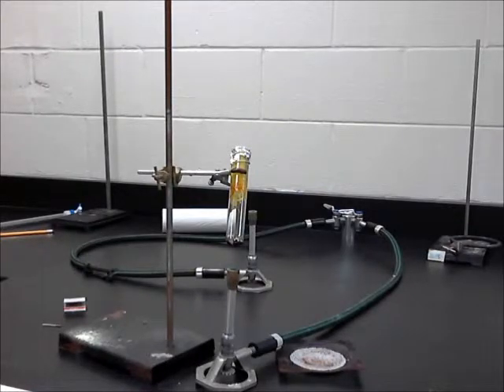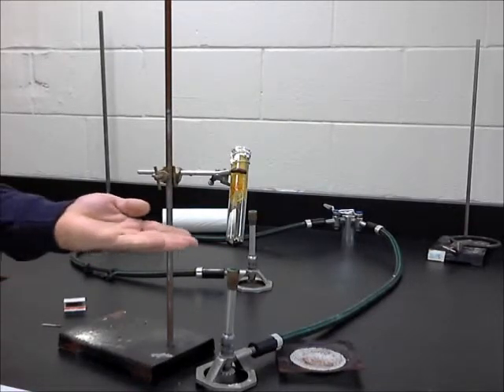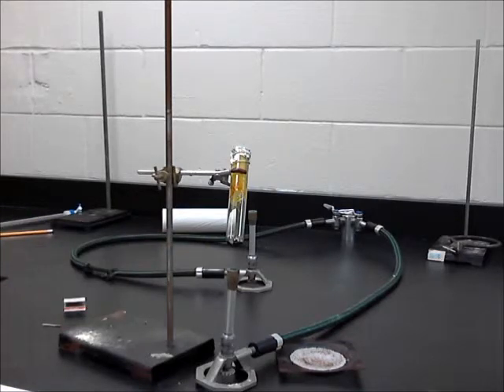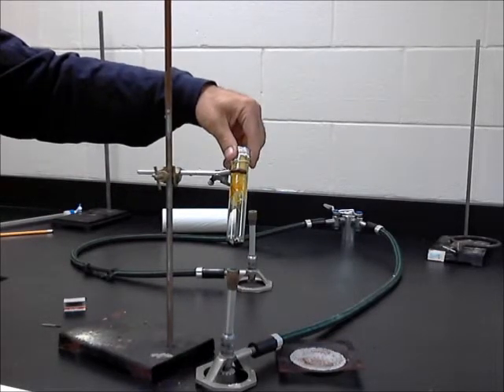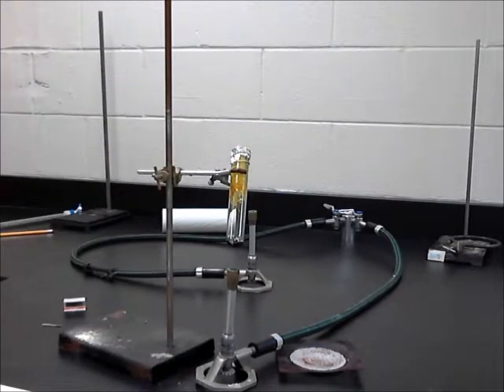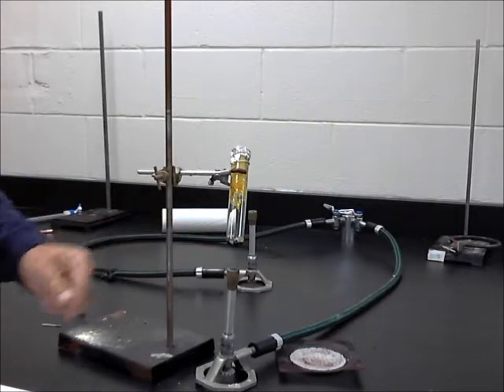So basically we would like to just see if a chemical reaction has occurred. Does our new substance have new properties? The top of this is not all that hot. When students do this lab, they tend to burn the living crap out of the thing. So it gets really hot. The bottom is hot. Notice how nicely it even kind of cleaned out.